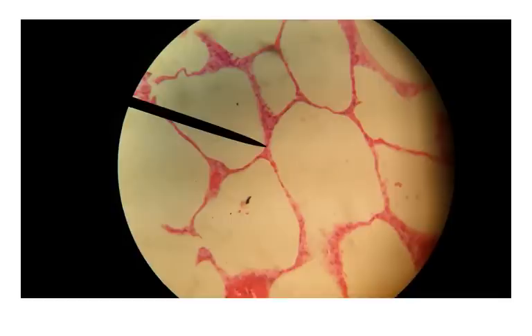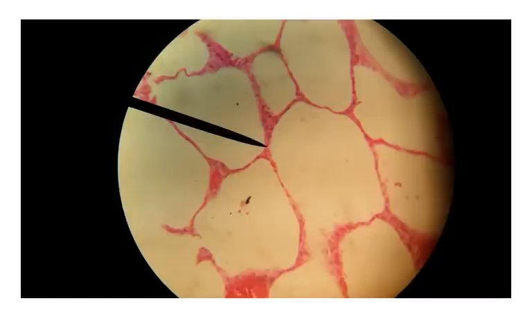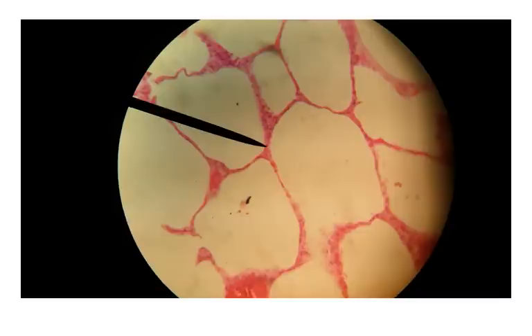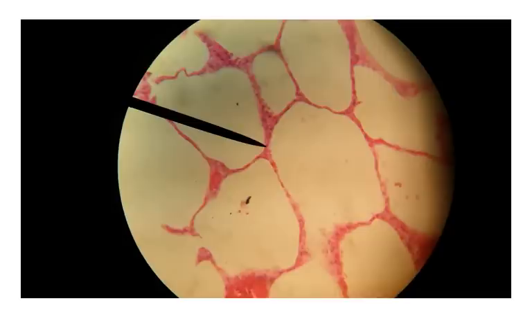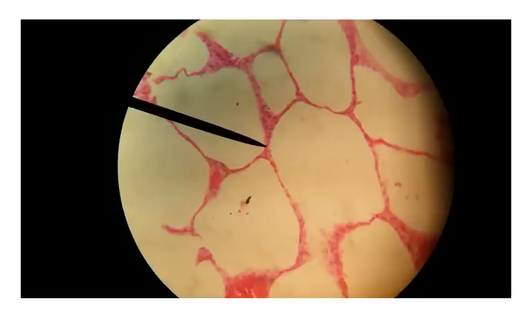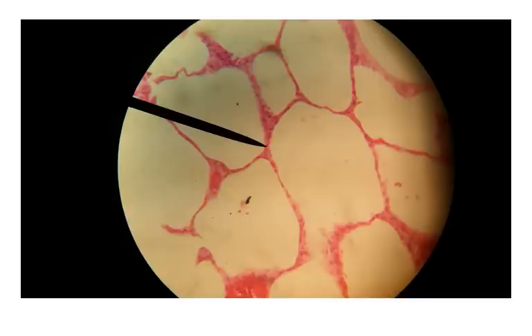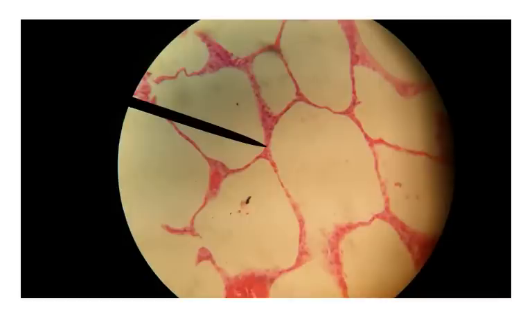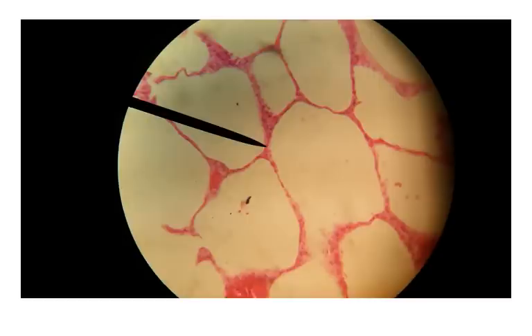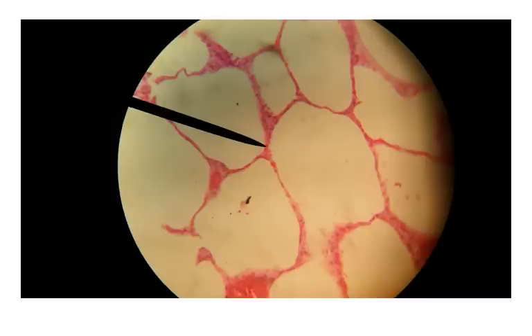A couple of ways to identify type 1 cells: they're very flat, and in the middle of each is a darker stained section — the cell nucleus — which is elongated in simple squamous epithelial cells. Compare that to the type 2 cell here at the tip of the pointer. Type 2 cells are simple cuboidal epithelium, and you can distinguish them because the nucleus of these simple cuboidal epithelial cells is round, as compared to elongated in simple squamous.